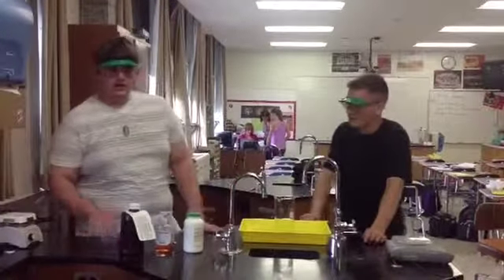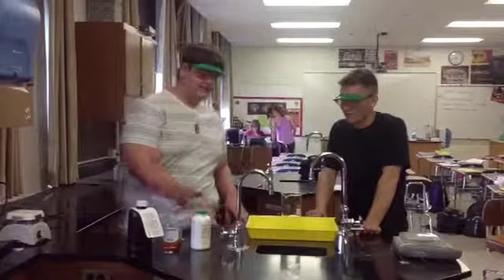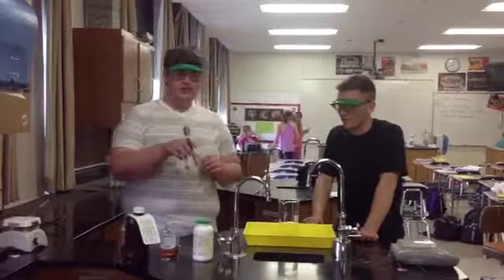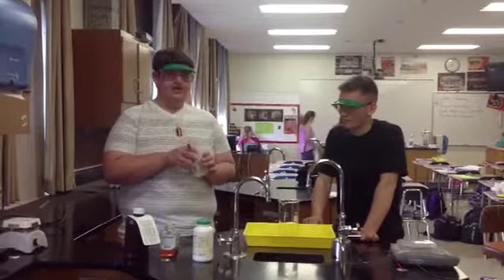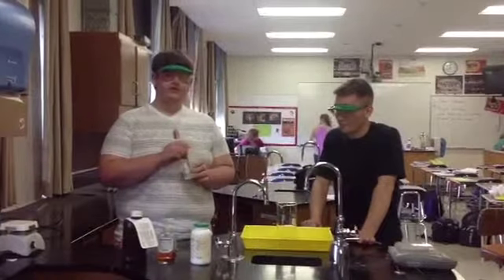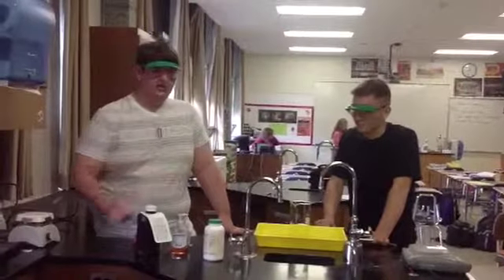This reaction works as a decomposition of hydrogen peroxide with a catalyst of potassium iodide, in this bottle here. We have a premixed solution already that is a saturated solution of potassium iodide of 70 grams potassium iodide to 50 milliliters of water. This will just accelerate the process. It does not get used up in the reaction.